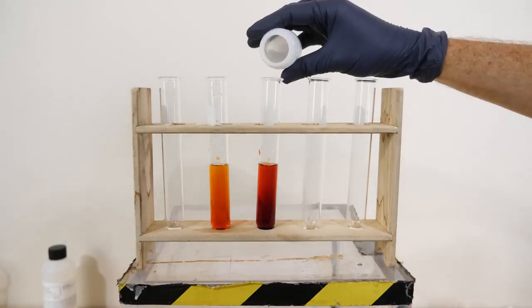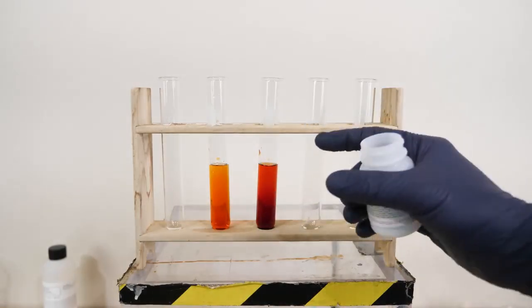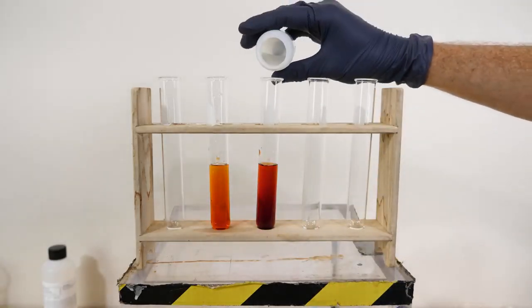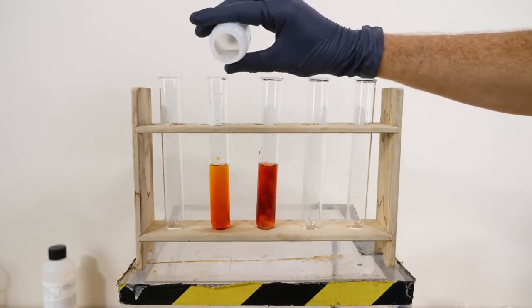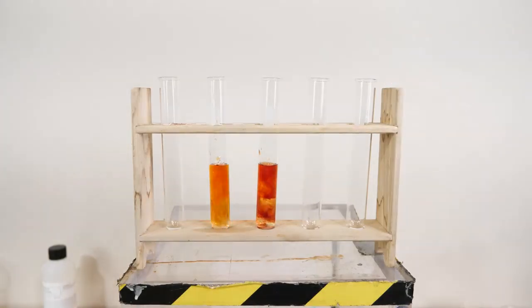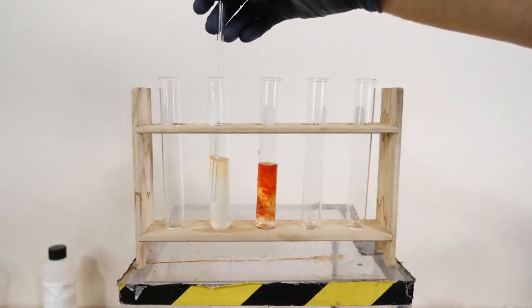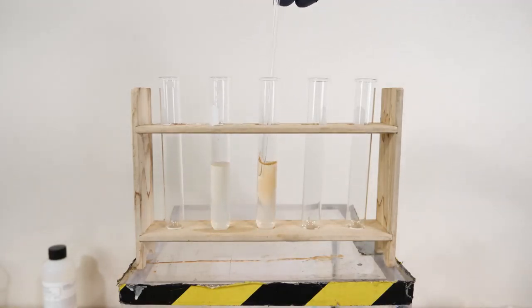So I'm going to do that by just adding in some sodium phosphate, and that'll react with the iron ions, and so it'll push the products to go back to the reactants, which should make it colorless. So in this case, we had too much product in there, and so it made the product do the reverse reaction and go back to the original iron ions and thiocyanate ions.